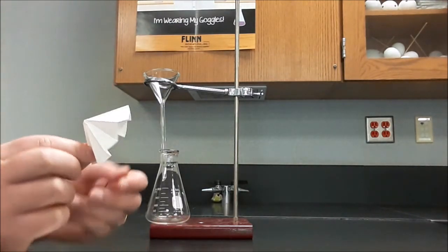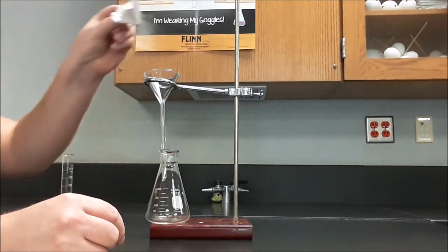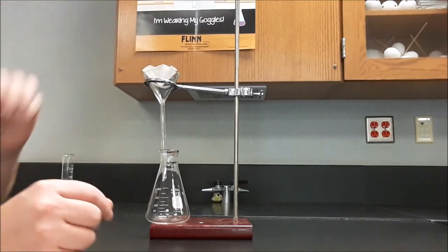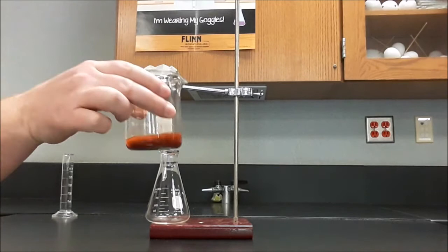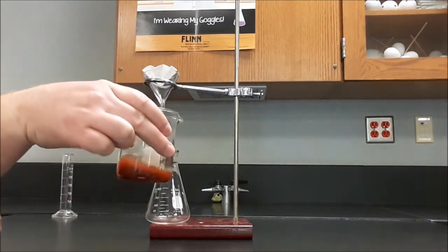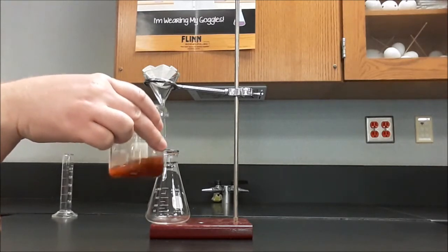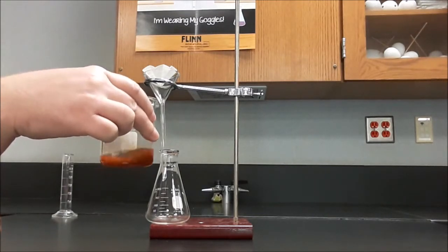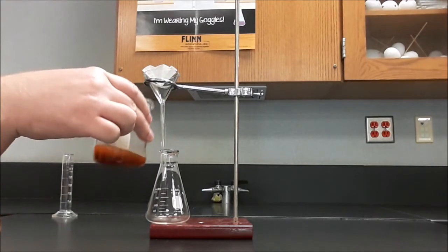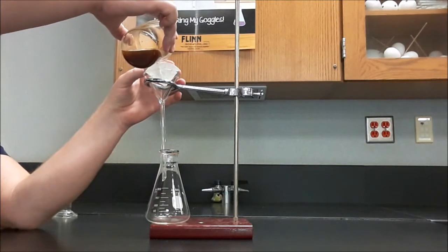So we'll take our filter paper that's been fluted and put that in the funnel, and it fits in the funnel, and there's ridges, and it's all ready to go. And then we'll take our precipitate. We'll want to swirl it up before we use it. What we want to avoid is the precipitate staying in the beaker. We want the precipitate to end up in the filter paper. So we'll swirl it up and then we'll add it to the filter paper.